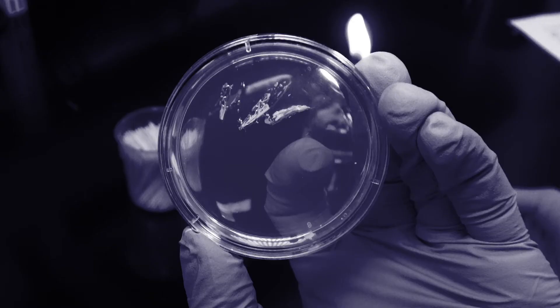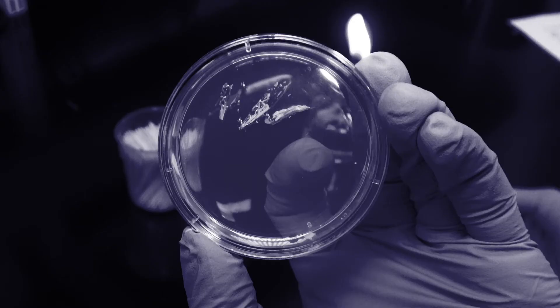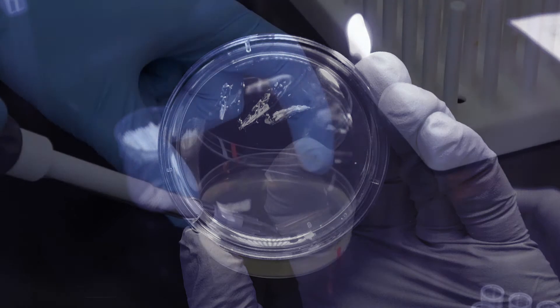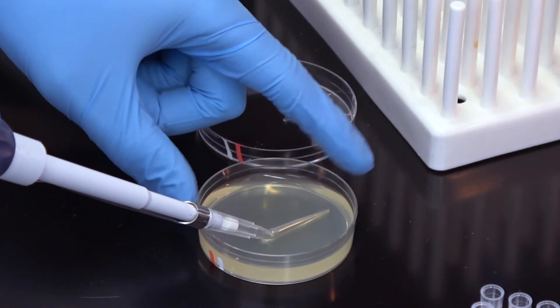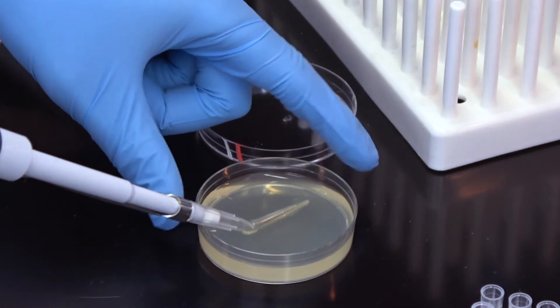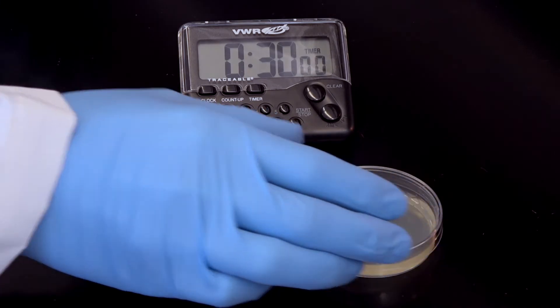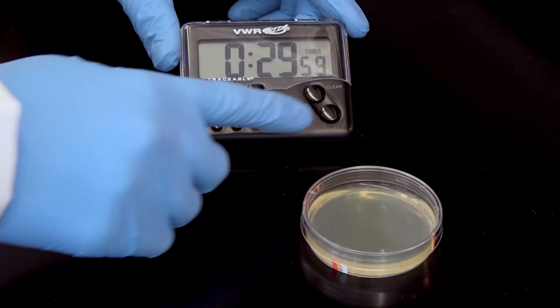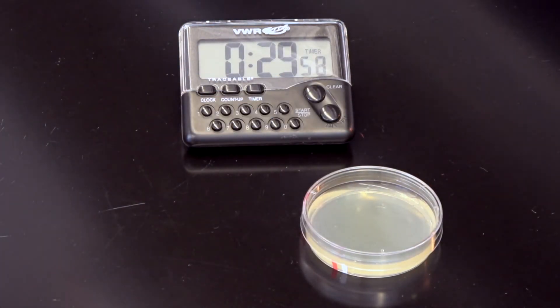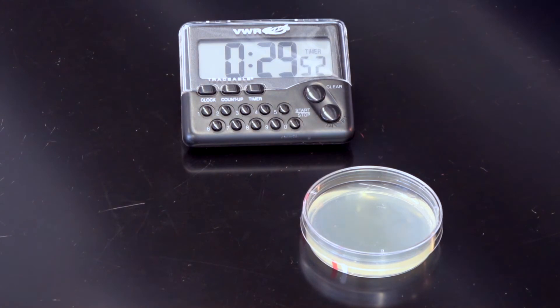Warning: be careful not to dig into the plate! With the antibiotic spread thoroughly, we now incubate the plate for 30 minutes at room temperature with the lid on to allow the antibiotic to more completely absorb into the agar.